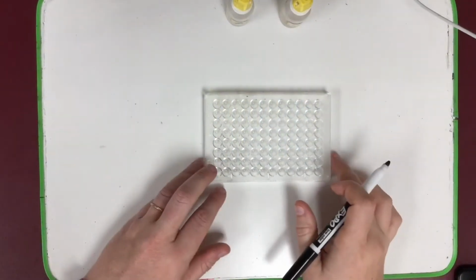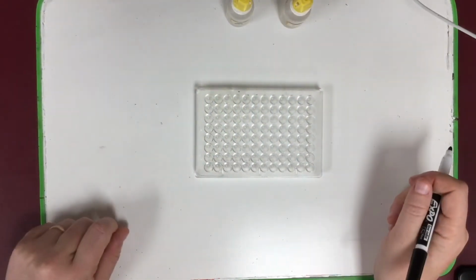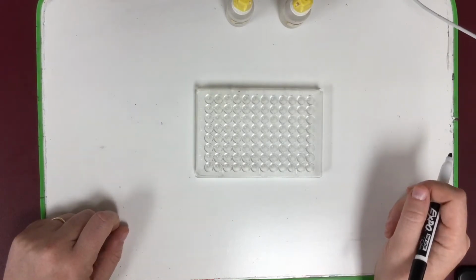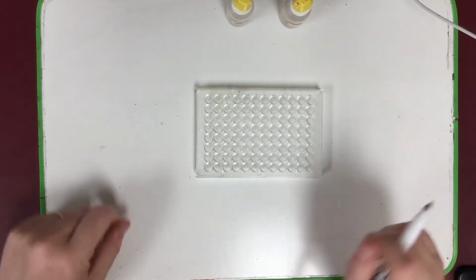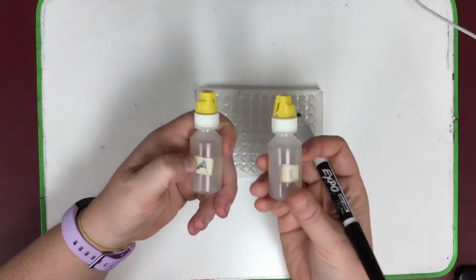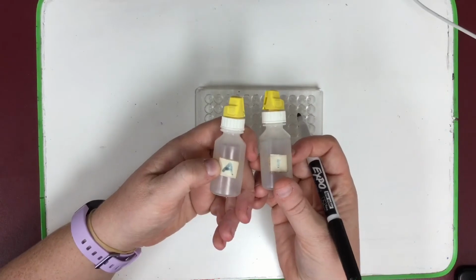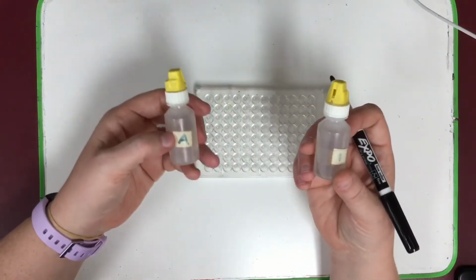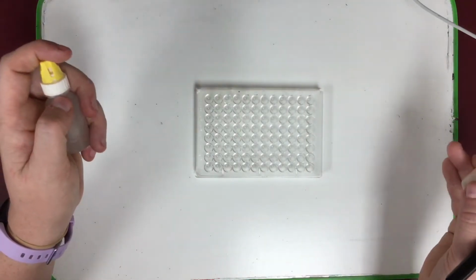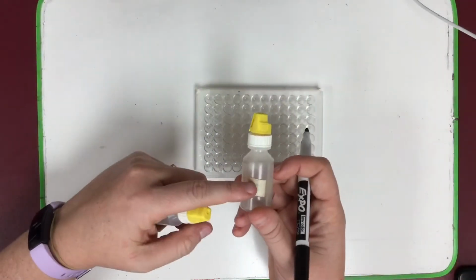The purpose of today's laboratory is to allow you to experience a little bit of what Mendeleev did when he created his first periodic table. And in order to do that, we're going to be reacting some solutions that have letters with other solutions that have numbers. Now, when Mendeleev created his periodic table, he first listed all of the known elements based on their atomic weights. That's kind of like our numbers.